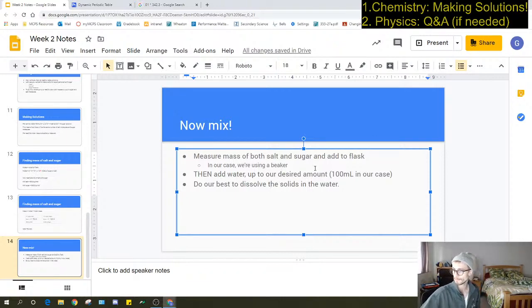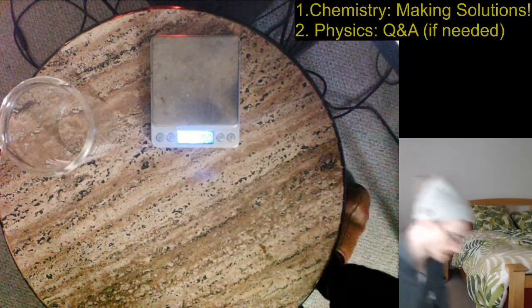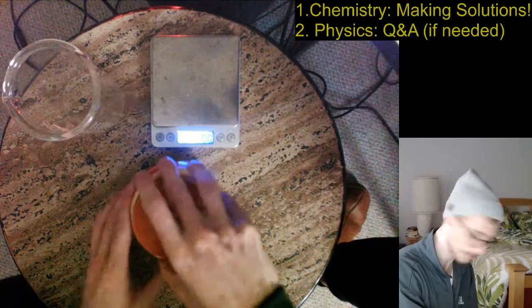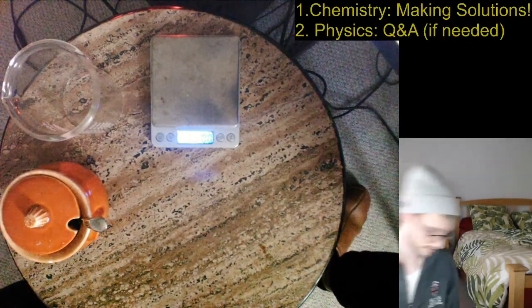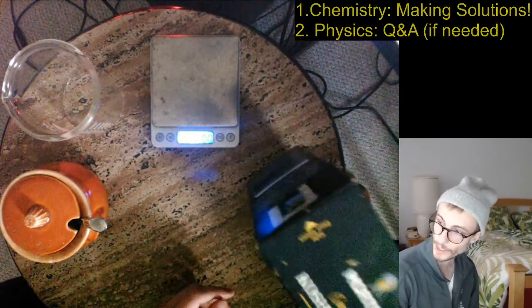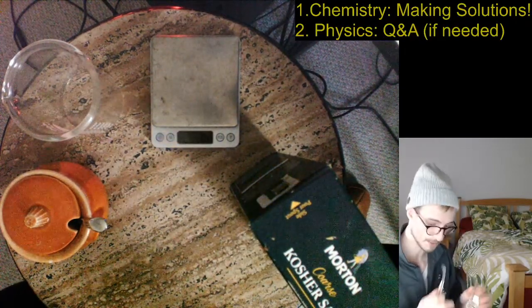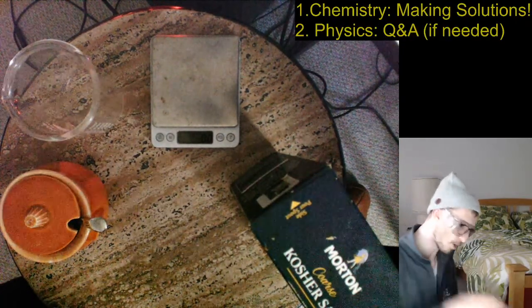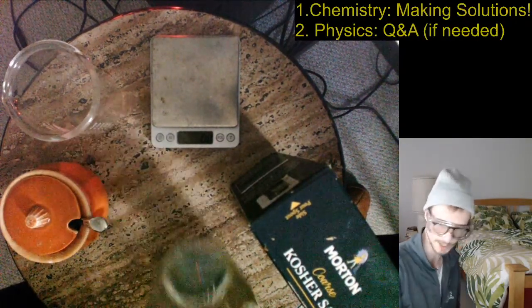Okay, so I'm going to switch over to my document cam. Okay, so you can see that I got my beaker here. I have some table sugar that I pulled out of my kitchen, so it's right in there. And I have some salt that I also pulled out of my kitchen. This is kosher salt, but it's basically the same thing. So we got all our stuff. I don't really need safety glasses because I'm wearing glasses, and also this is salt and sugar, but I'll put them on just because I miss being a scientist. And then I also have some water that I just got out of a Brita filter and then poured into this flask, and I'm going to use it for dissolving stuff.